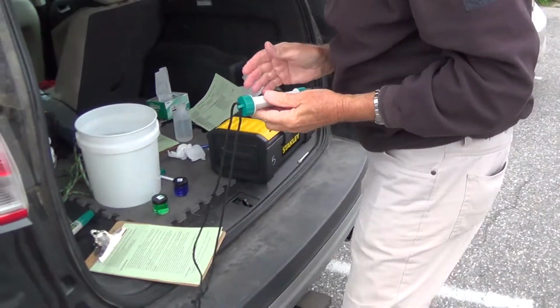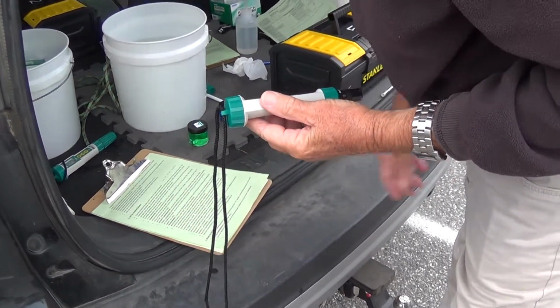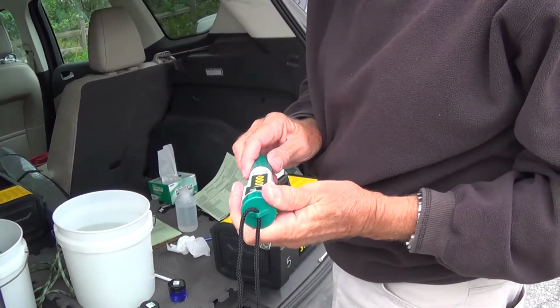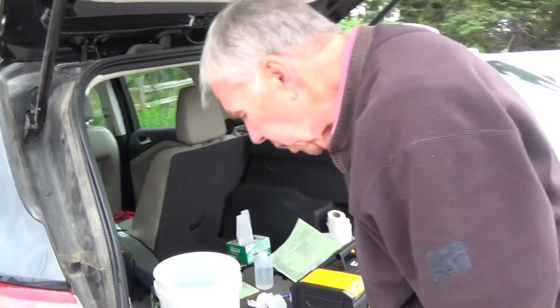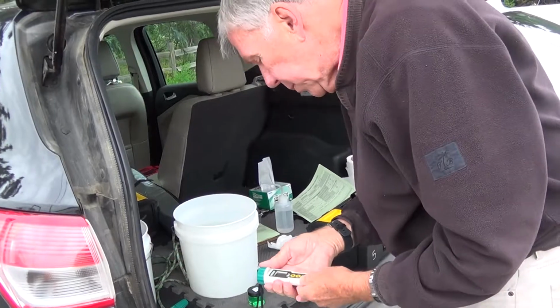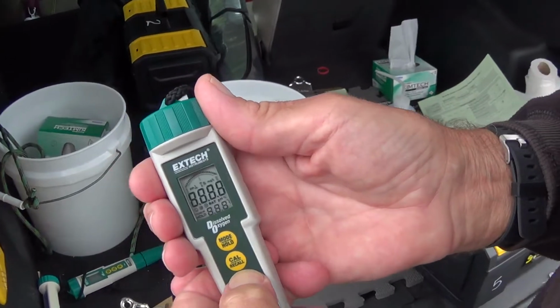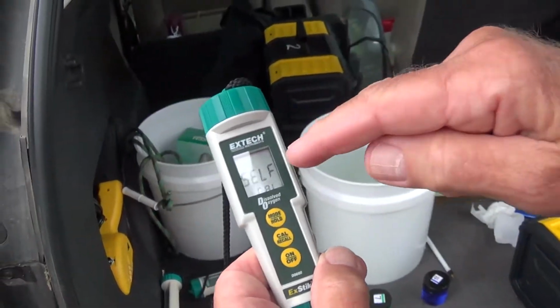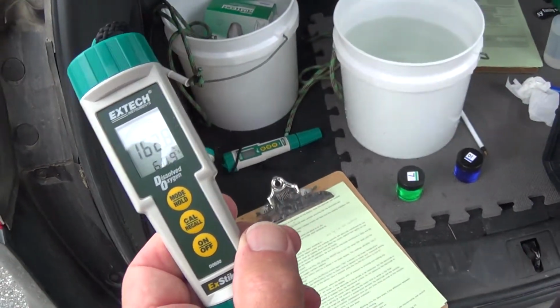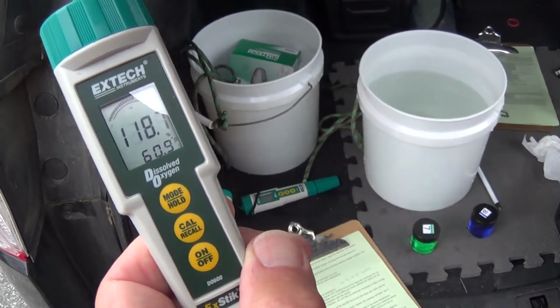So, after that inspection, we want to turn it on. So you put the cap back on. And what you're doing is you're calibrating this to the air. So, with the cap back on, we hit the on button, which is this one. And then we wait for this, it says self-calibration. So we wait for the numbers to stabilize. And it says in the directions that this can take a while.